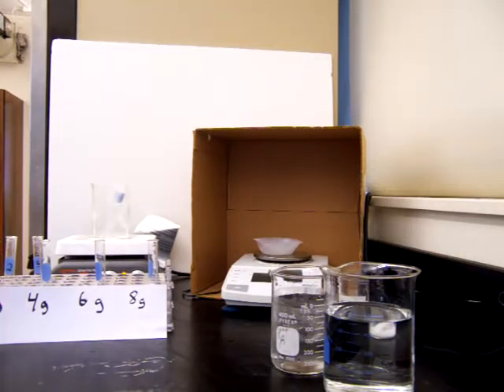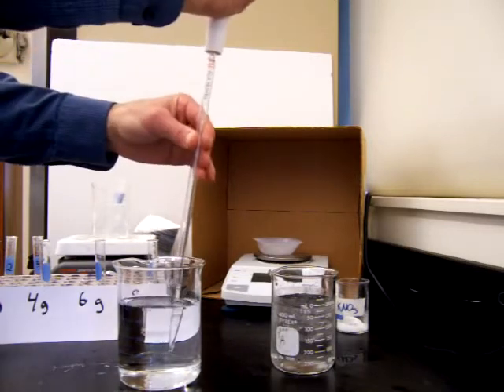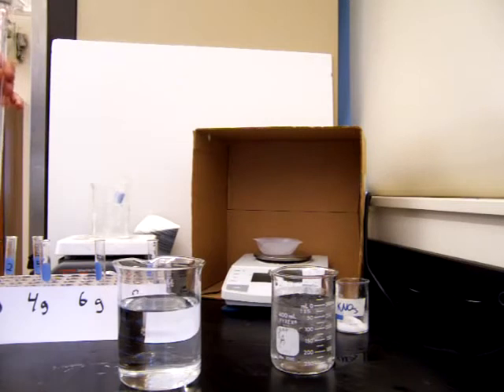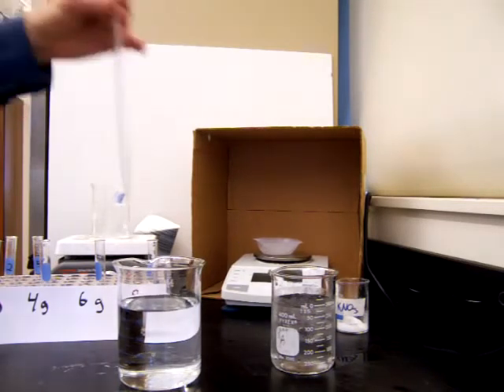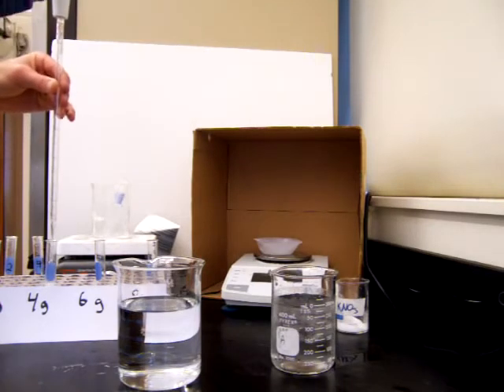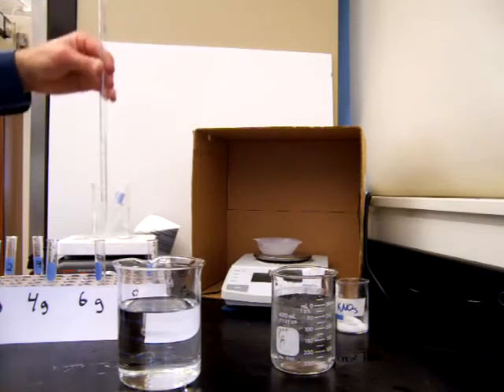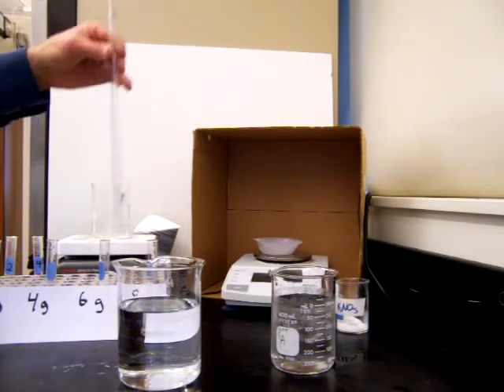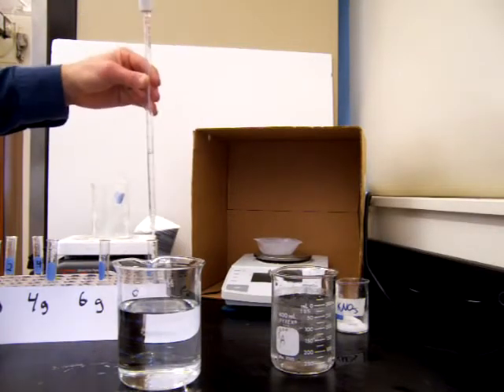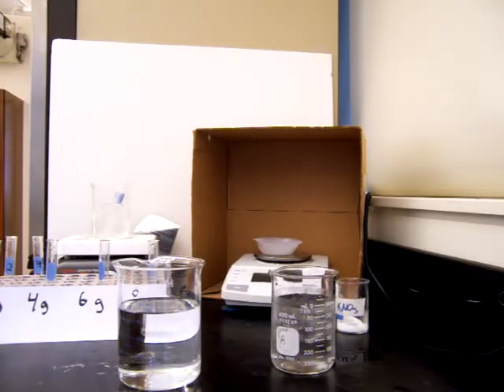So to each of those samples, we're going to measure out 5 milliliters of water. So we take a 5 milliliter sample of water, we'll measure it with our pipette, and we'll add 5 milliliters of water to each of the 4 test tubes. So we're trying to make solutions here with different concentrations. Concentration is the ratio between solute and solvent. So our solvent here is water, and we're having 5 milliliters of water in each of our solutions, and then we'll vary the amount of the solute, the salt, potassium nitrate.